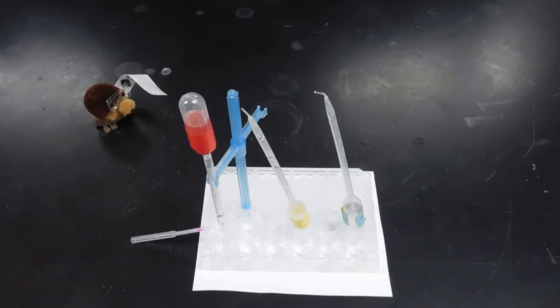Keep in mind that it's probably best to do 3 titrations, see if the results are in agreement. If they are, then I don't need to do another, but if they're significantly far off, whatever significantly is, based upon your teacher's evaluation of significant, you probably want to do another titration.